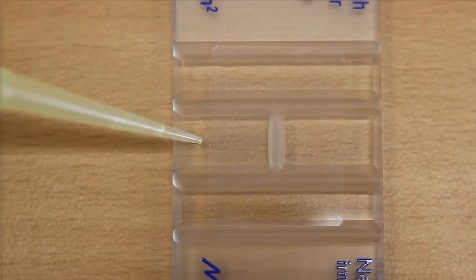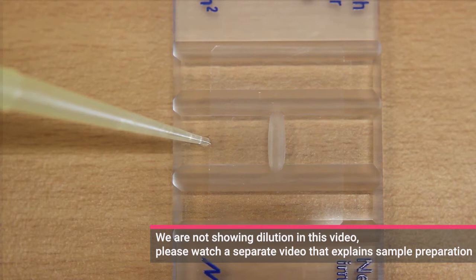Load the chamber by pipetting your sample next to the coverslip. Capillary forces will suck the fluid into the chamber. Make sure not to overload it.